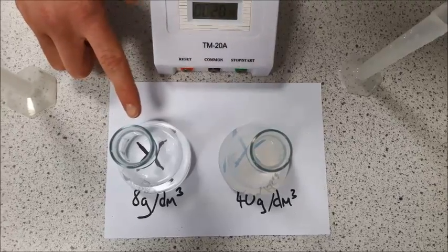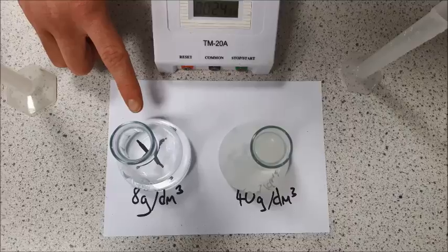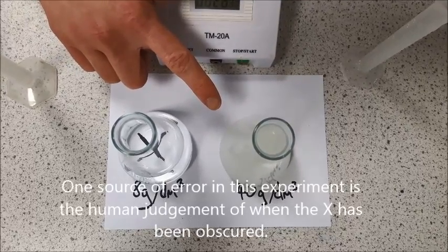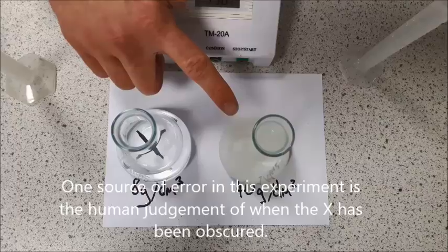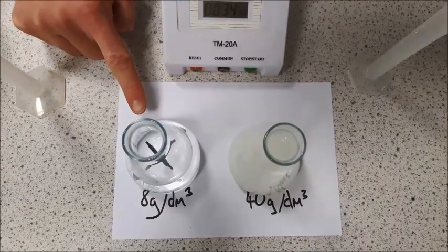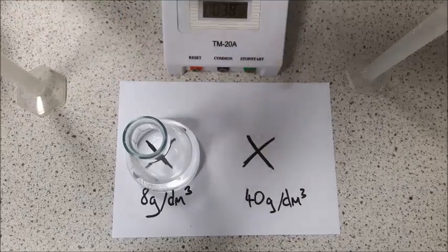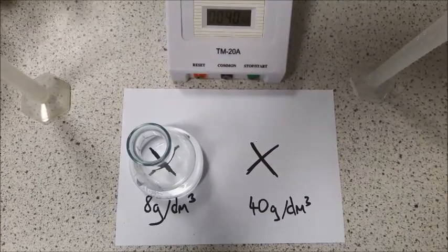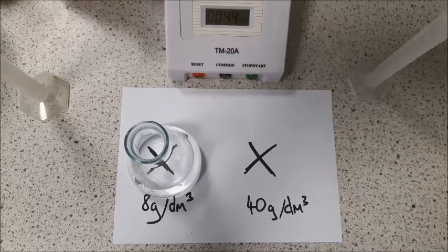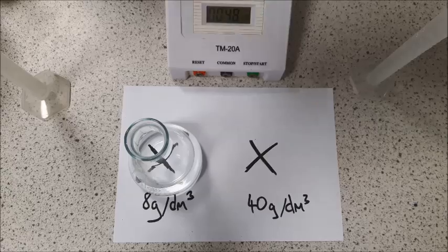This one has done very little so far. So you can see the enormous difference in rate of reaction. This one, I can no longer see the cross, so I would stop and record how long that was. This one, you can see, again, there's been very little change so far. So this one I would take away and pour into my stop bath to prevent excess production of sulfur dioxide gas. This one I'd have to leave until I can no longer see that cross inside.